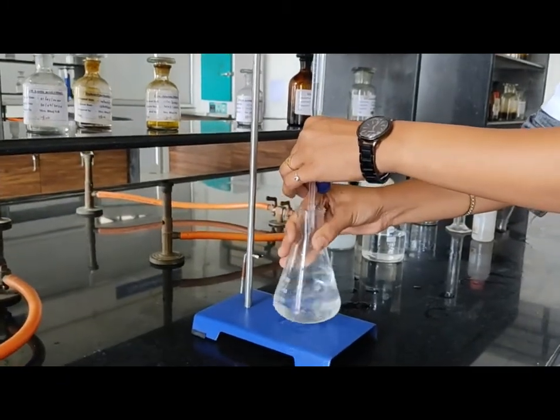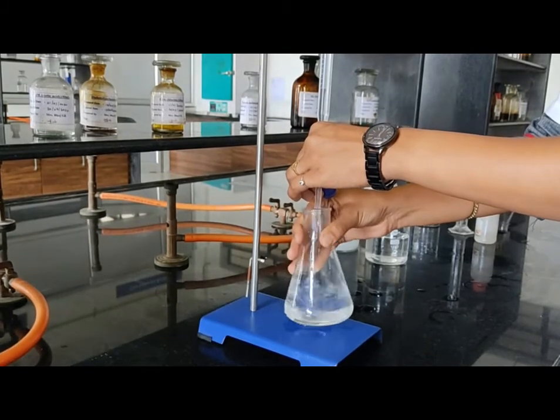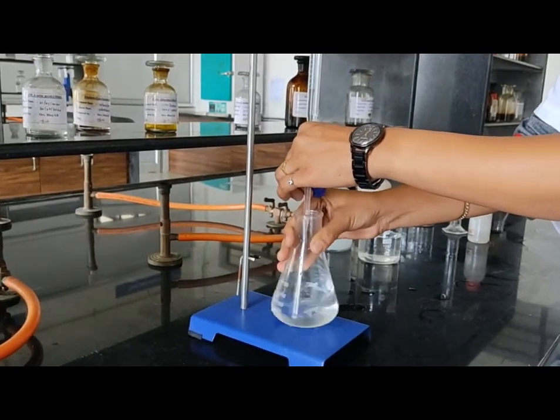Titrate with constant stirring so the reaction occurs simultaneously and we get a sharp endpoint.